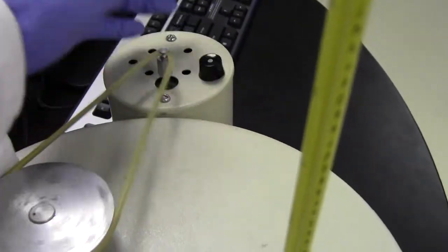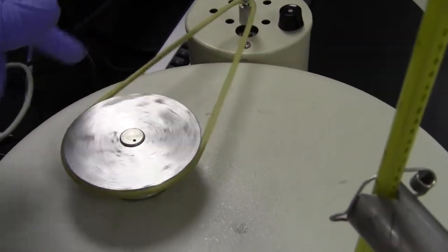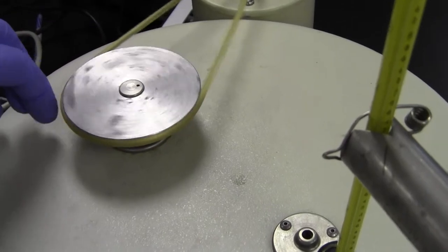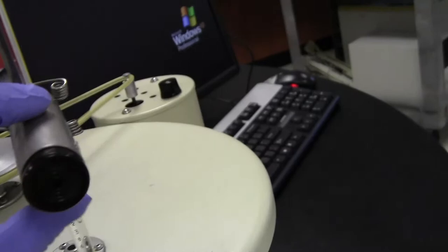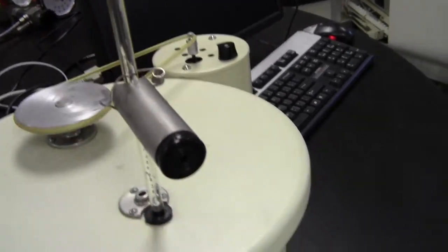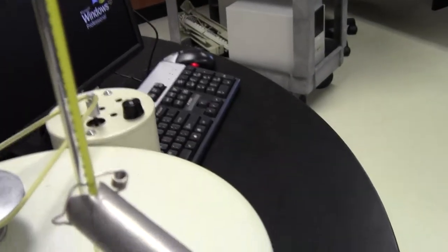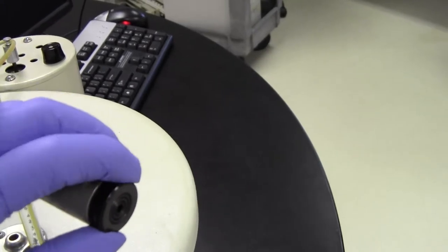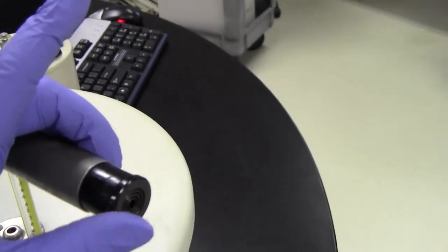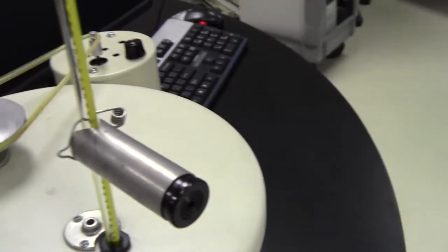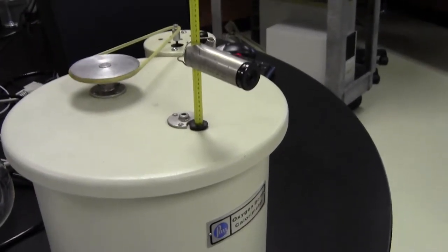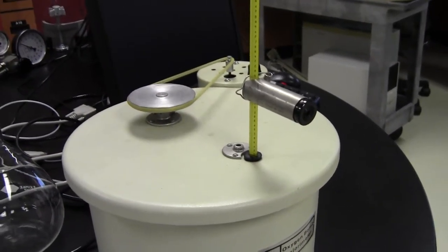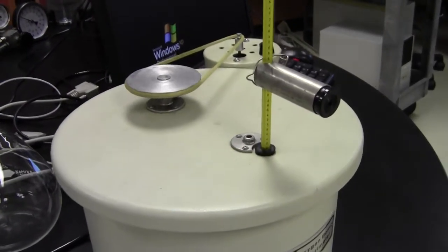Turn the switch to the right to turn it on, and that will stir the water and bring the contents before reacting to thermal equilibrium. And you'll have to read the temperature using this little telescope glass on the thermometer. And if it's not in focus, you can focus by pulling that out and pushing it in. So try not to remove your goggles to actually see that.